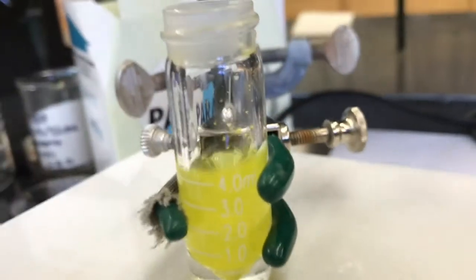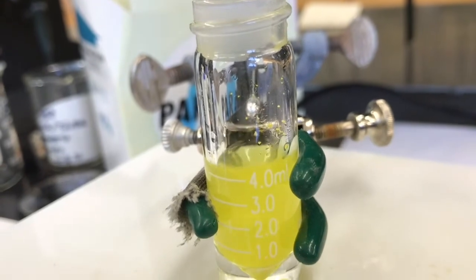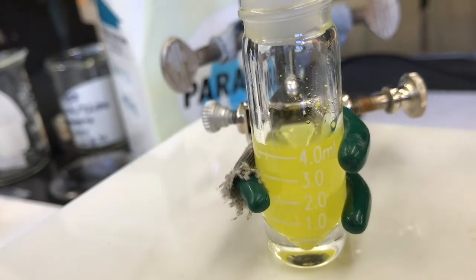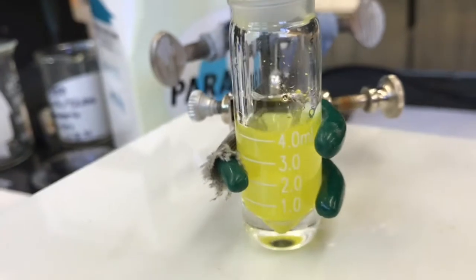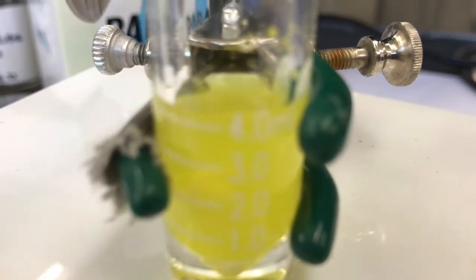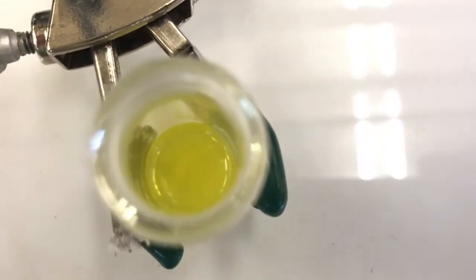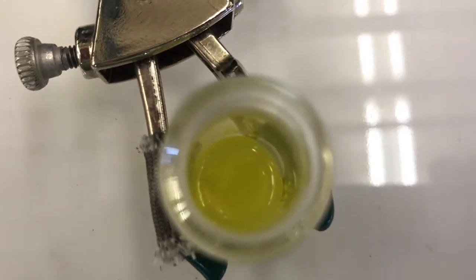Looks like there's a little bit of solid up along the walls of the solution. I could try to get that down in solution or just live with it. I think I'll just live with it. Let's stop the stirring, see if it looks like it's dissolved. Looks pretty good. It's hard to say, huh? Even for me live, it's hard to say whether it's all dissolved, but I think most of it is. And even if it's not all dissolved, I think it'll be fine.